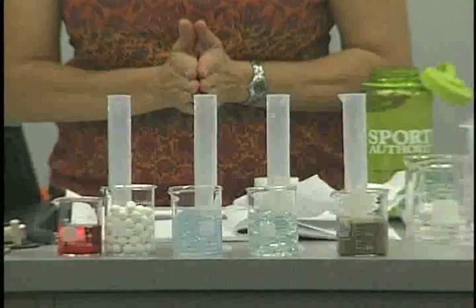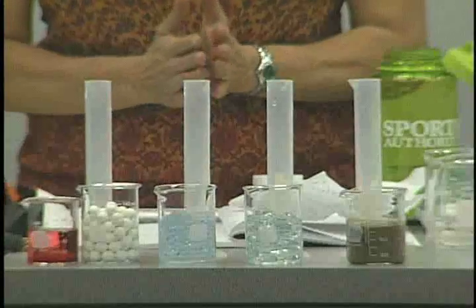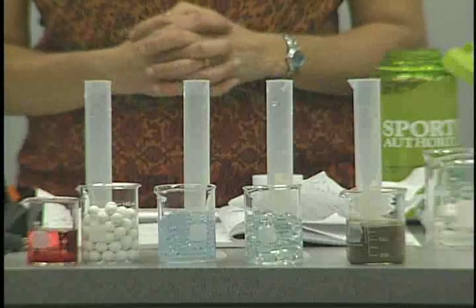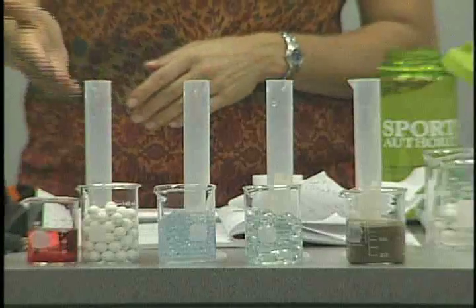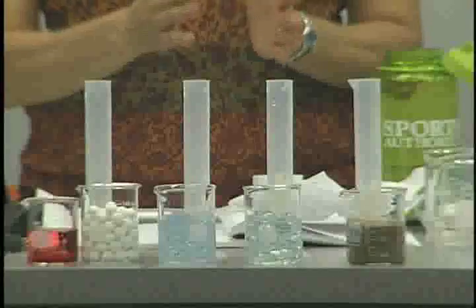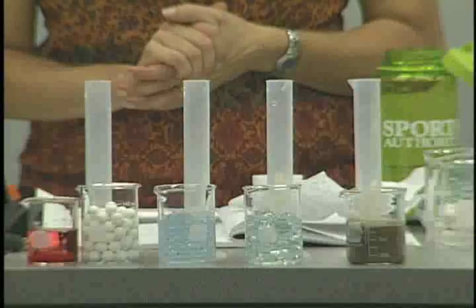If the total volume occupied by sand and water is 100, what is the percent in the beaker that was water? Okay. So we've got 100 milliliters, and so you're simply going to take the number that we had, 43 milliliters, 42, 35, that is the percent water. Those numbers are the percent water.